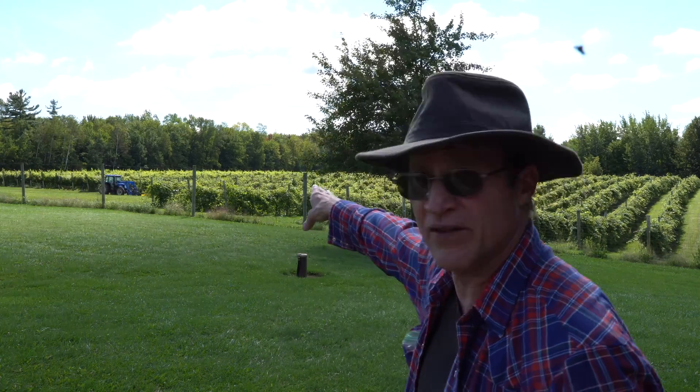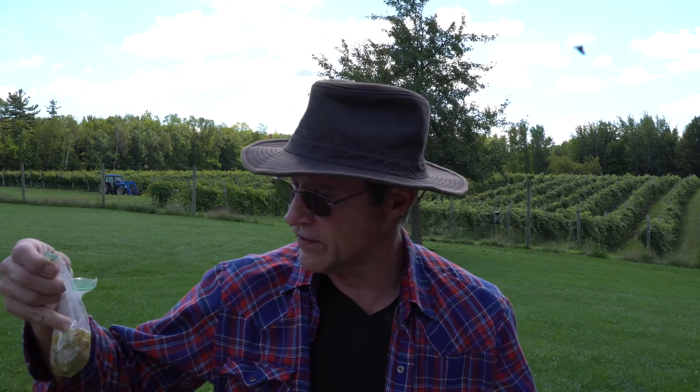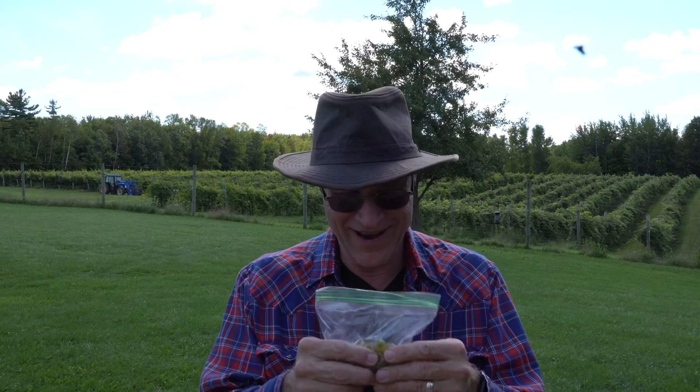Jay Stager again. We are standing by the vineyard. The pickers are out there. I'm looking at not today's picking, but tomorrow's or Friday's picking or maybe even next week's, depending on how these samples come out. So I got grapes everywhere. These here are very important — they're our Itasca grape, which I just picked 100 berries of. And now I'm going to crush them up.